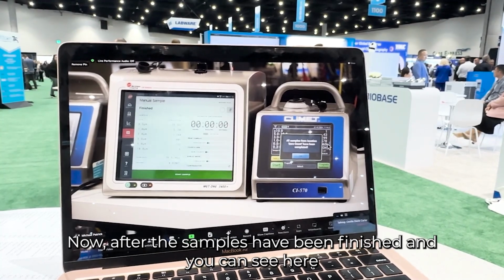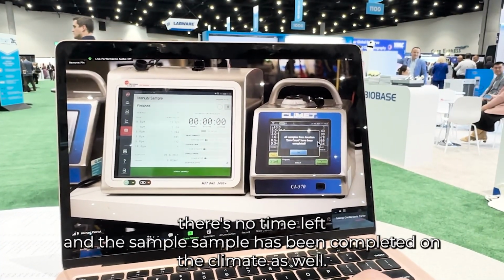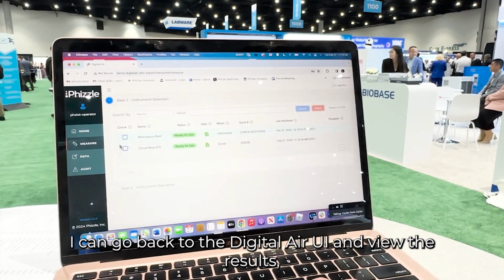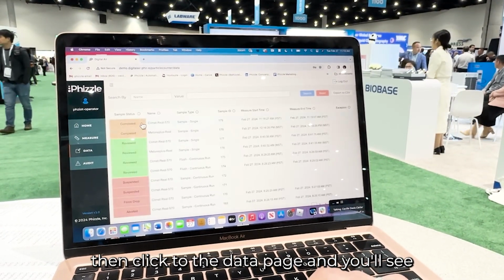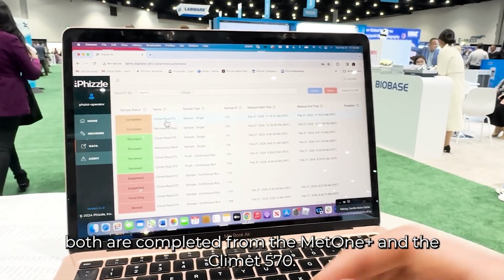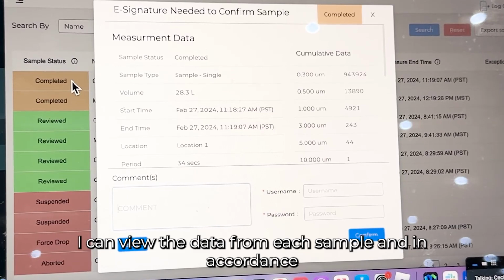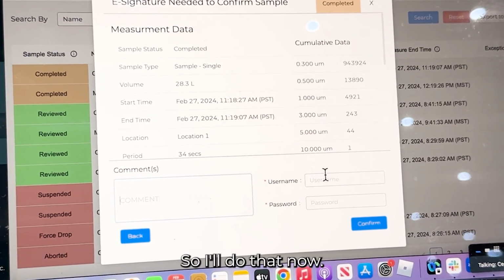Now, after the samples have been finished, and you can see here, there's no time left, and the sample has been completed on the Climet as well, I can go back to the Digital Air UI and view the results. I'll then click to the data page, and you'll see both are completed from the Met 1 Plus and the Climet 570. And after the samples are completed, I can view the data from each sample, and in accordance with 21 CFR Part 11, verify it with an electronic signature. So I'll do that now.